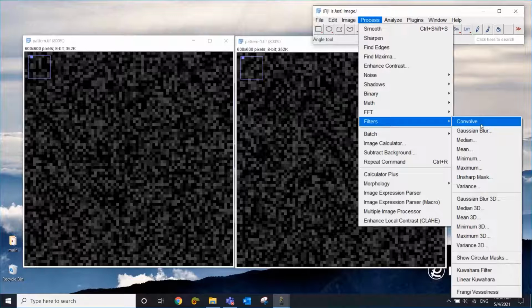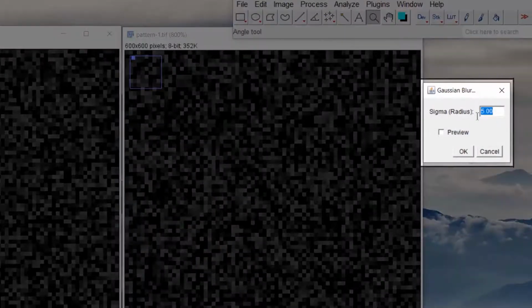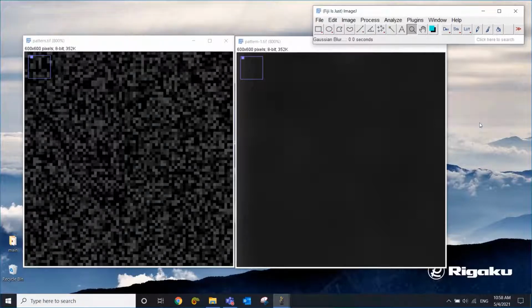Let's start with Gaussian blur. This is a classic smoothing filter. Let's start with something small, let's say 2 pixels radius, and you can check preview to see how it would go. Okay, so this is not too bad, but I still see kind of lighter, darker areas, so I'm going to be aggressive and do 5. So this is completely smooth. You know, the noise is gone. So let's say I'm happy with this and I click OK.